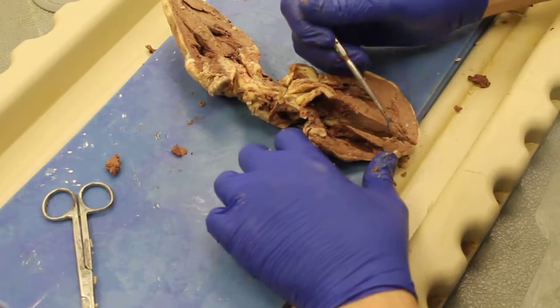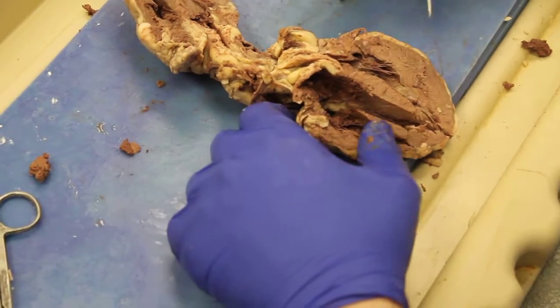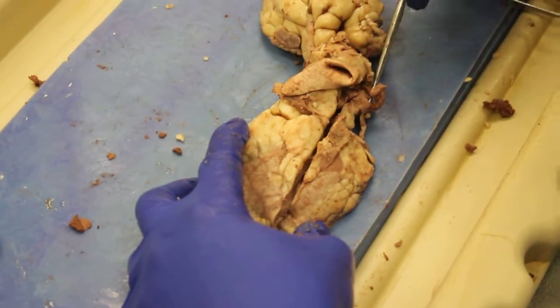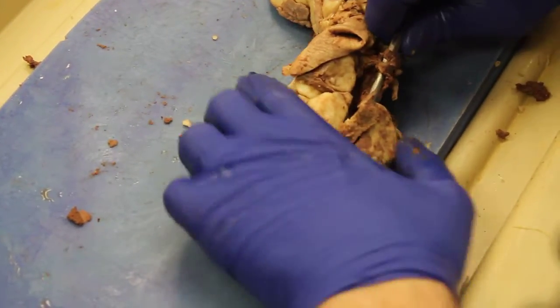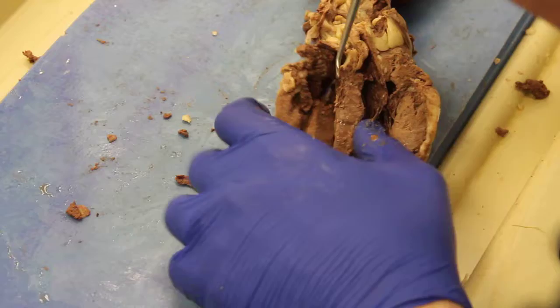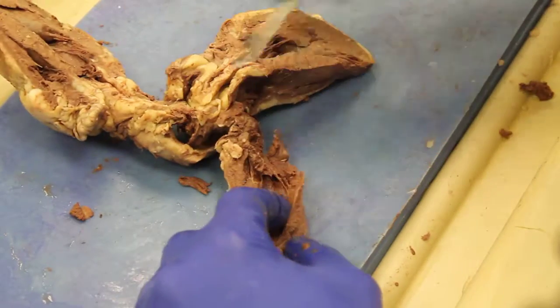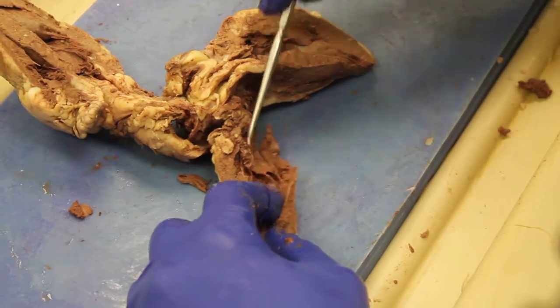Okay, so I've done some quick, quote-unquote, edits to the heart to get a little better of a view. And going in through the vena cava, I have found my way into the right atrium. And from the right atrium, I have now opened this up, and from here I now have my atrioventricular valve with one of the leaflets of my tricuspid.